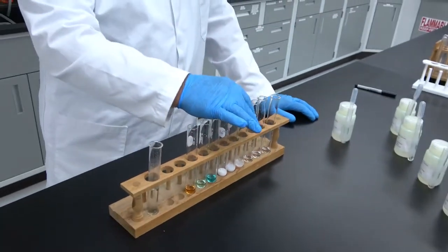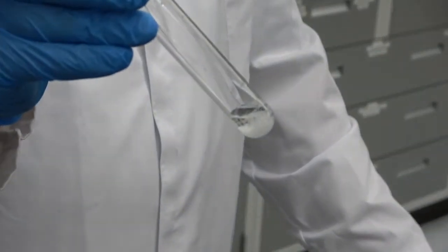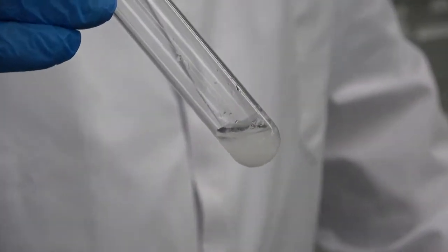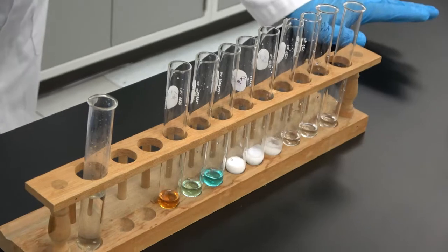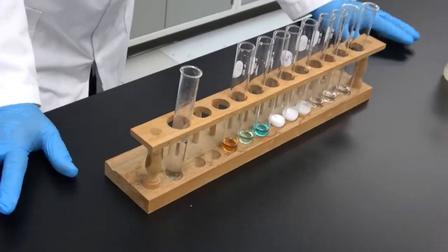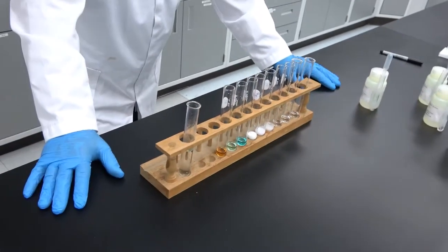As I said, we were going to come back to calcium. Look at that. So the first impression was not correct, right? This is the case where a reaction is slow and it takes a little bit of time for the precipitate to form. But again, here you have a precipitate. And that's about it in what we want to know about each one of these ions and how they react to ammonium hydroxide and ammonium sulfate.